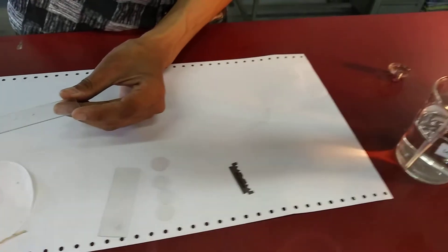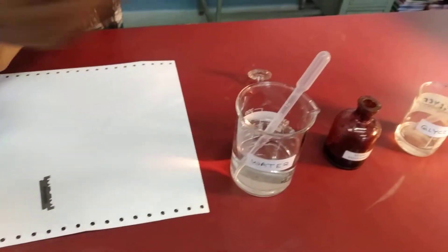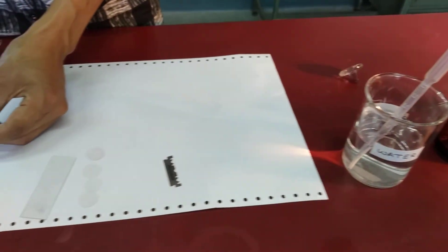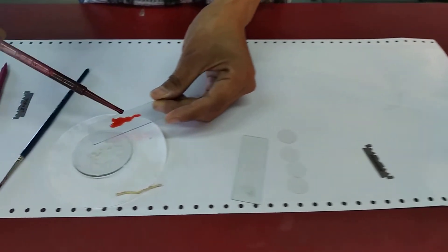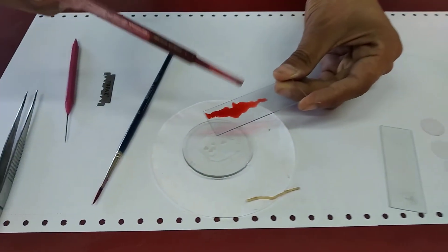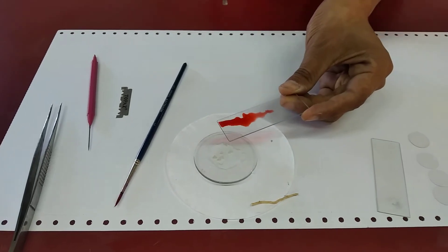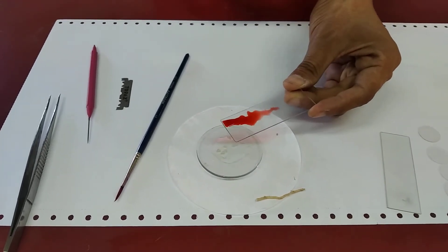Then stain it. Just a drop will be enough. Wait for 30 to 40 seconds.